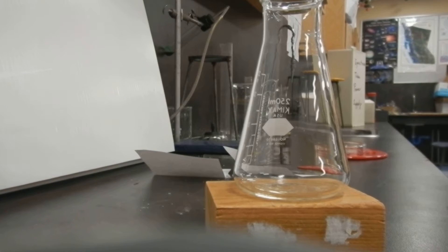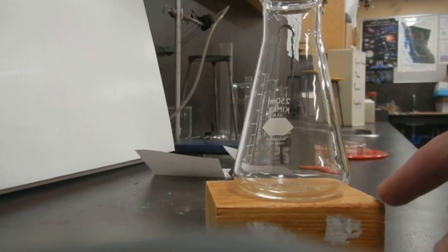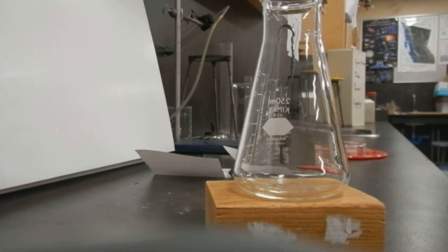Good day. We are looking at an endothermic reaction this time. I've got a flask, I've got a block of wood, and I have two powders.